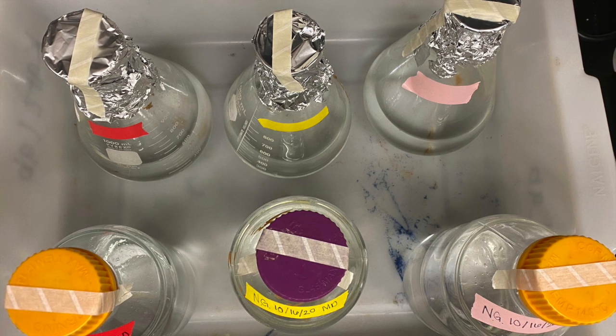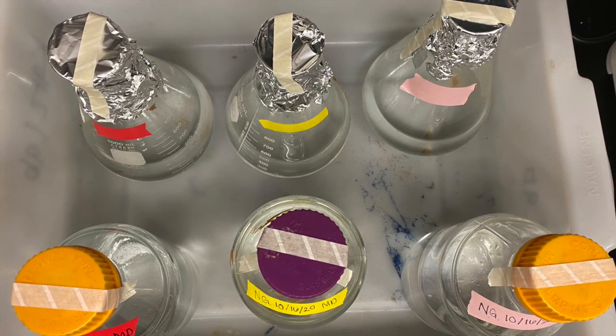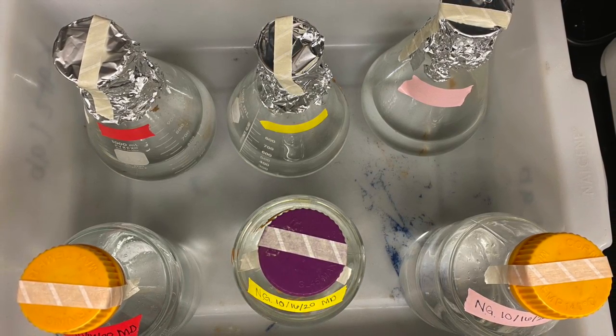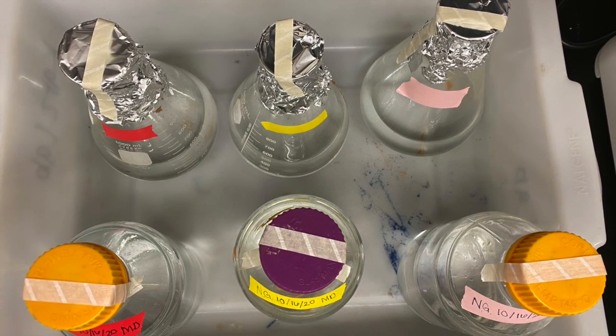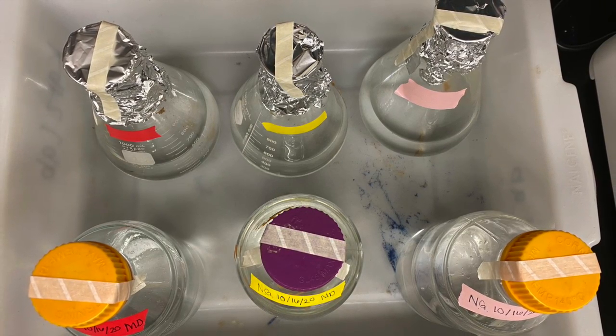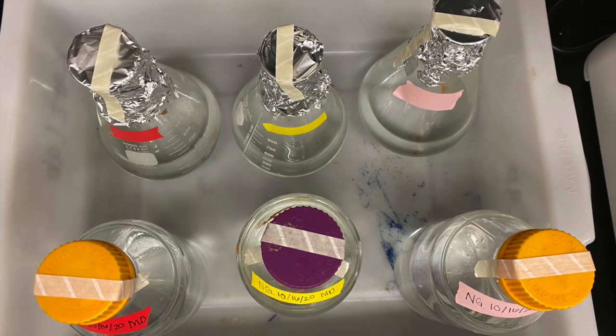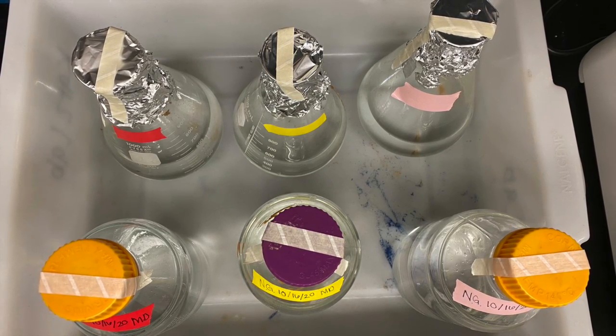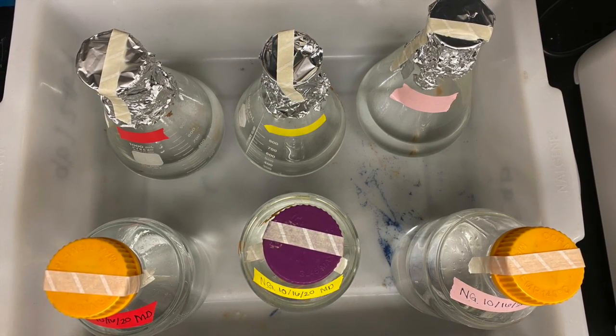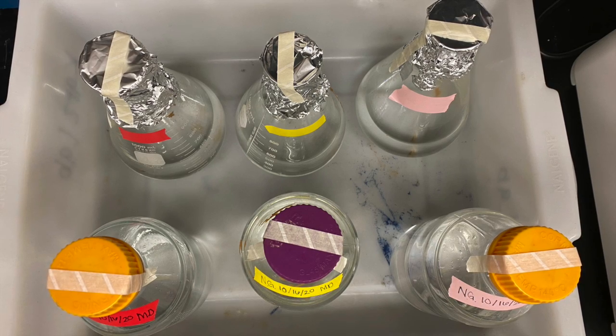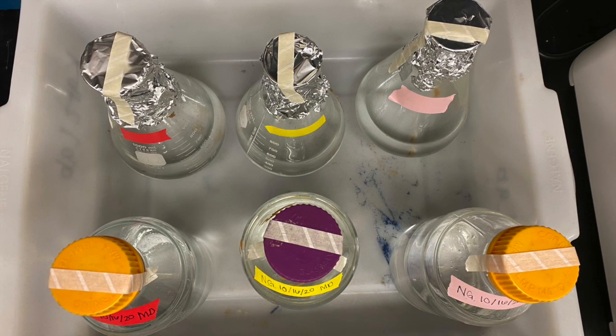Make sure to place your media solutions into a secondary autoclave safe container. Also divide any full bottles, such as the 1L Pyrex bottles, into two 500ml vessels. Remember to unscrew any tight caps and always use autoclave tape to indicate whether the autoclave run was successful.